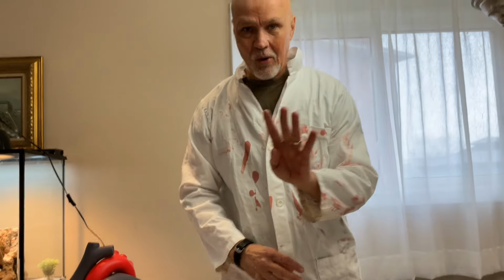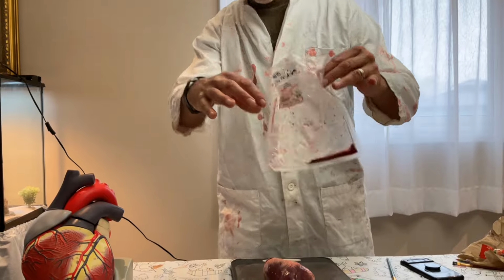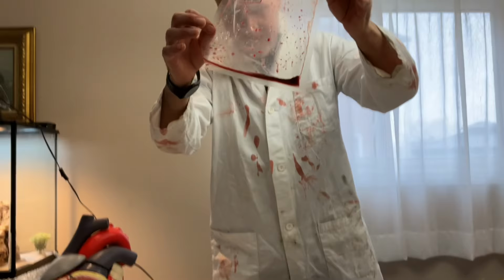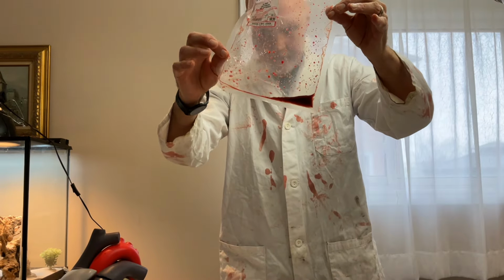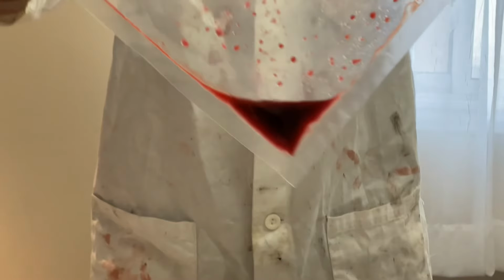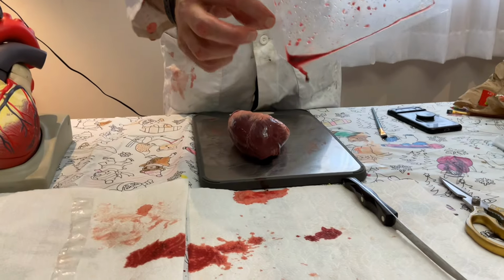Now, before I go on to talk about the actual heart itself, let's dispel the rumor that blood is ever blue. So this is blood that's deoxygenated, okay? So deoxygenated blood, and you can see it's red. Whoop. It's red.